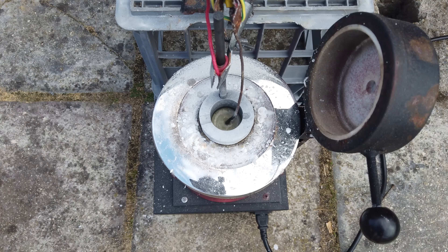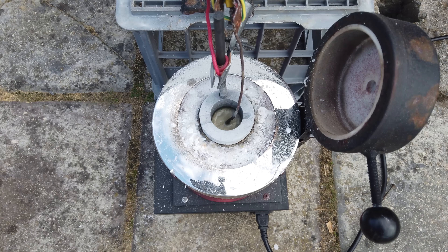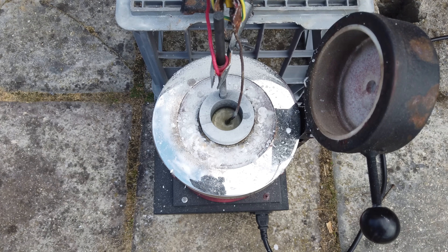Now the one issue here, I think, is that we're running this reaction at temperatures at which the magnesium metal is forming as a solid. In all of the other molten salt electrolysis experiments we've done, we formed the metal as a liquid, which has been easier to extract. I don't know whether I'm going to increase the temperature to make it a liquid, or if I'm just going to try to grow solid magnesium on the cathode, because that does seem to be working well.